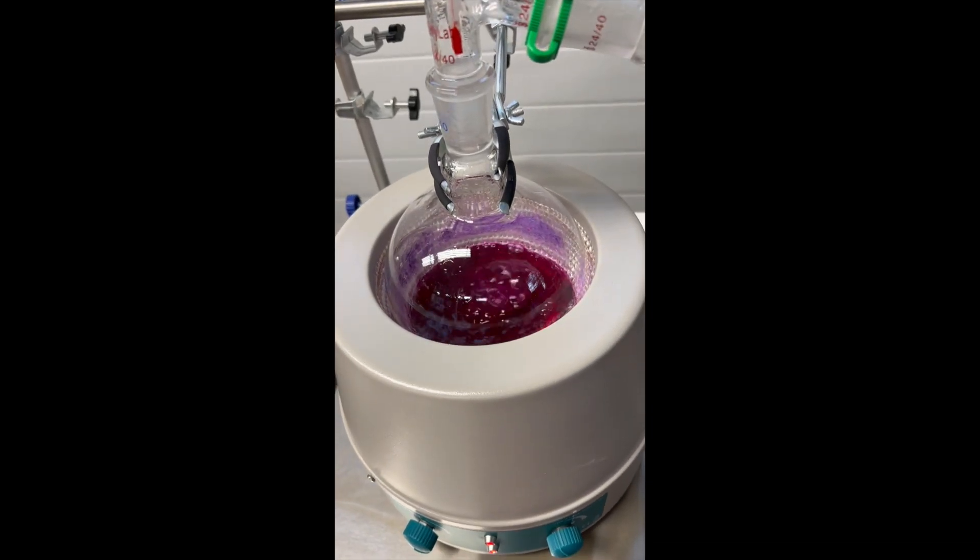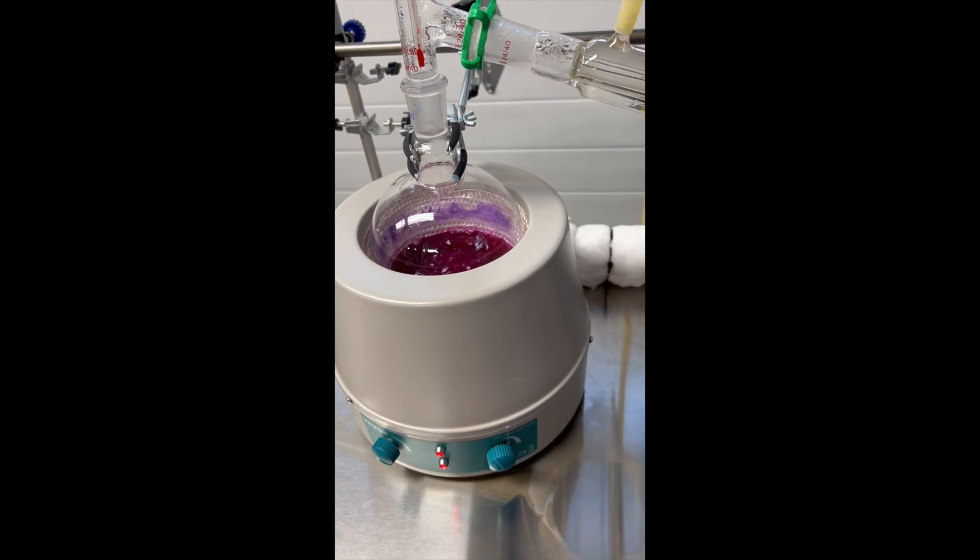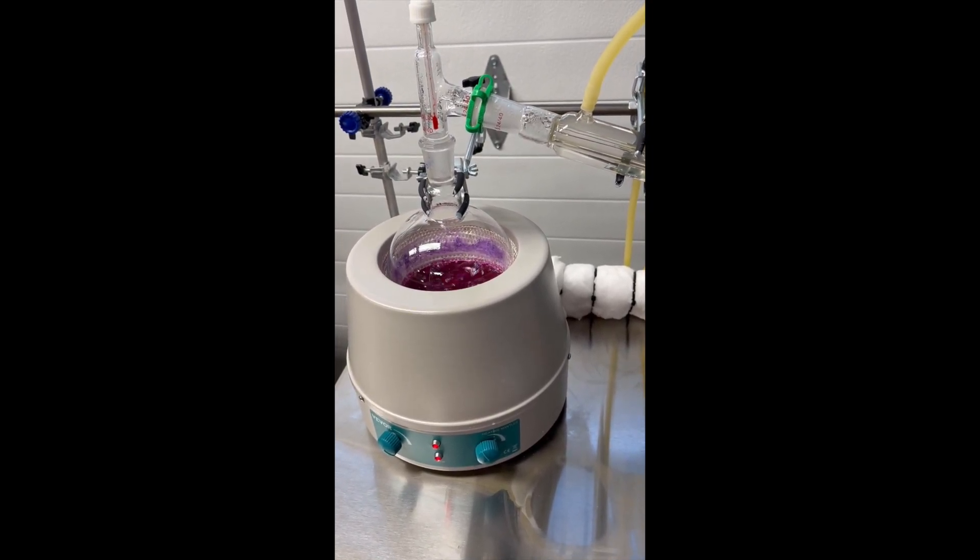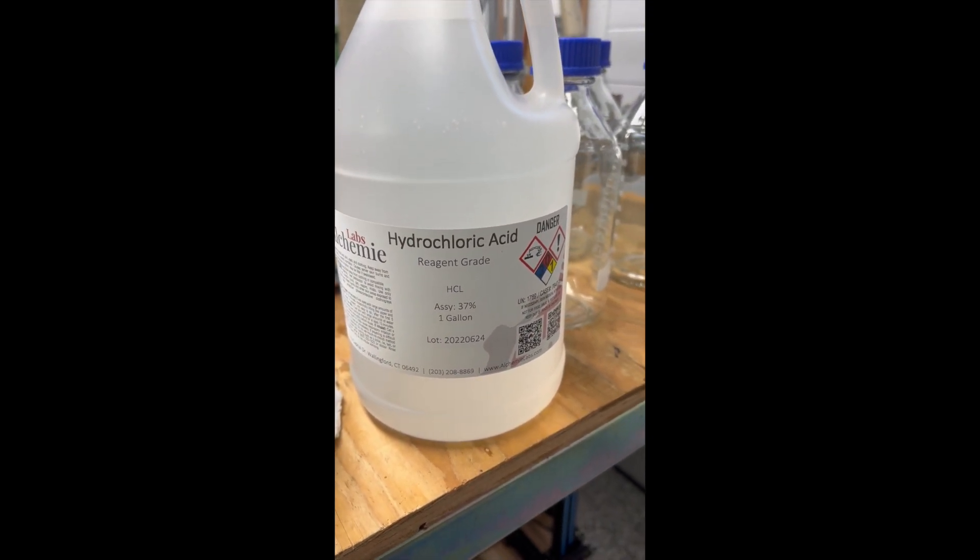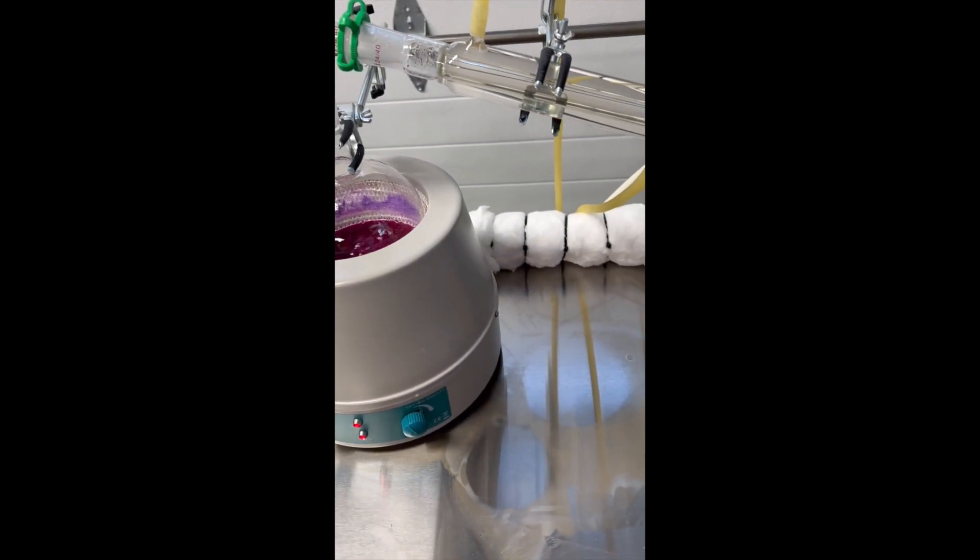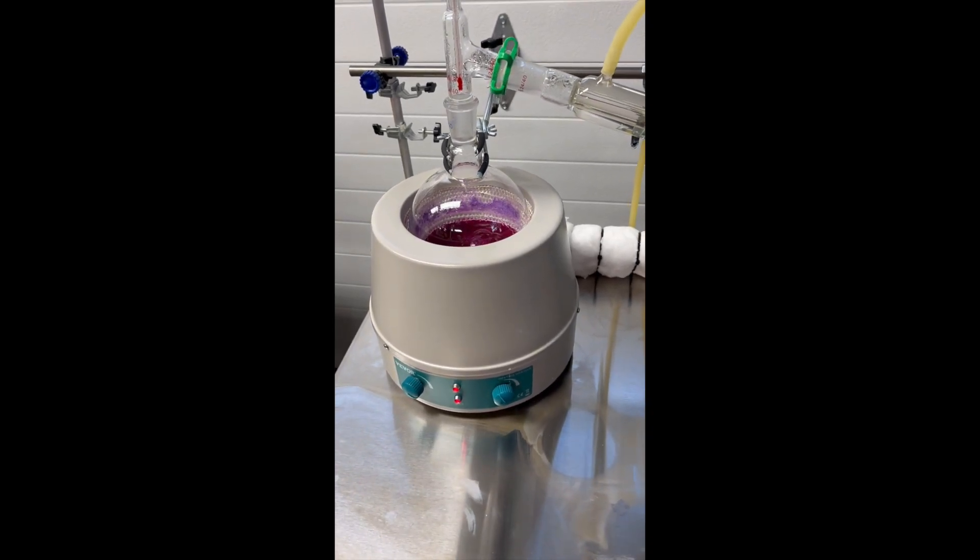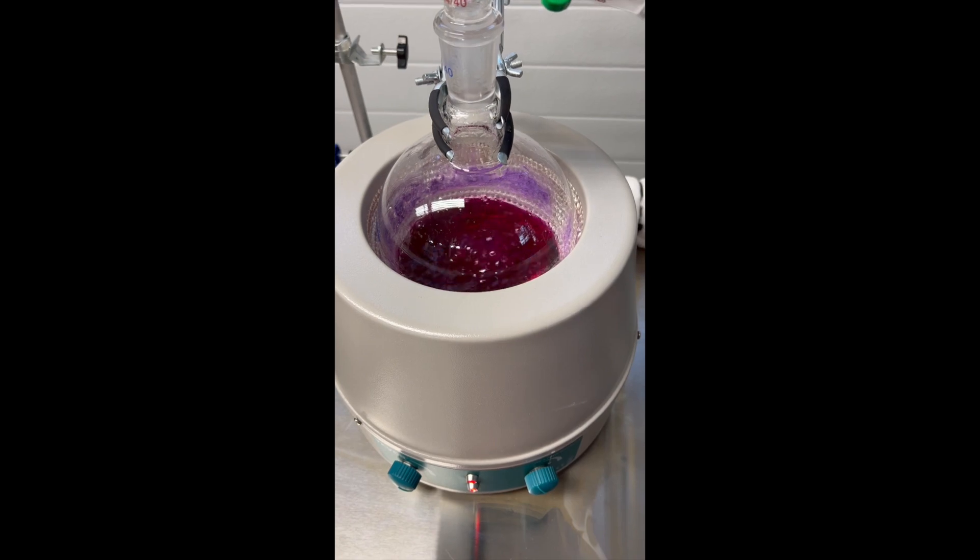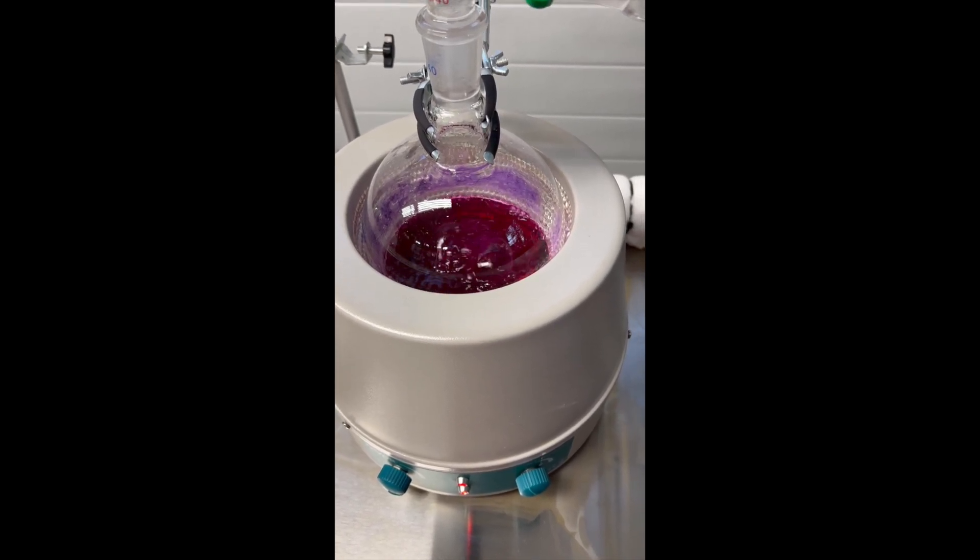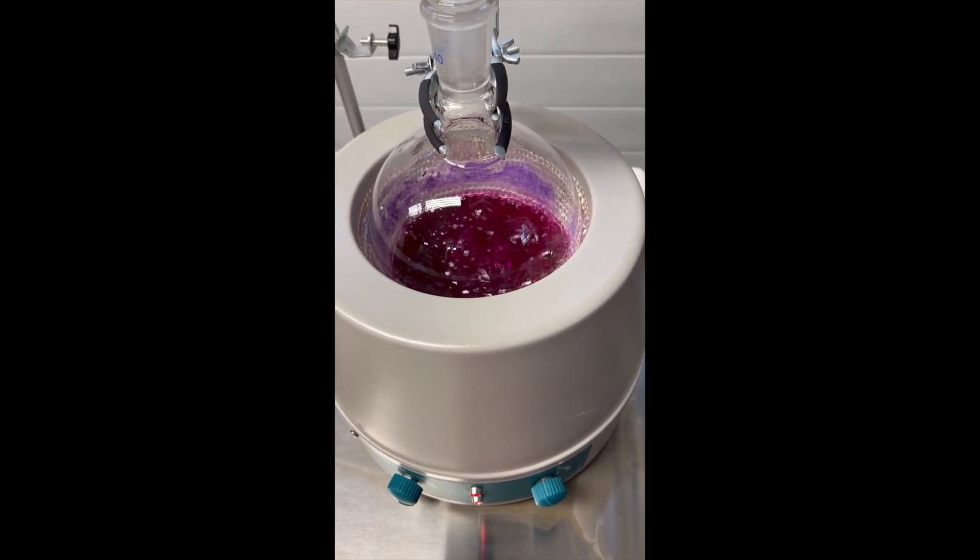Before I put it in the still here, I neutralized the sodium hydroxide electrolyte with hydrochloric acid to bring the pH down to 7. So it's neutral now. Then in the reaction that's just going to leave me with water and sodium chloride, regular table salt.